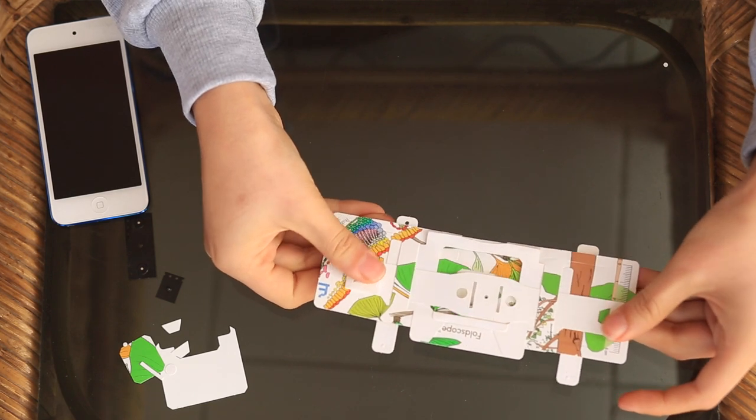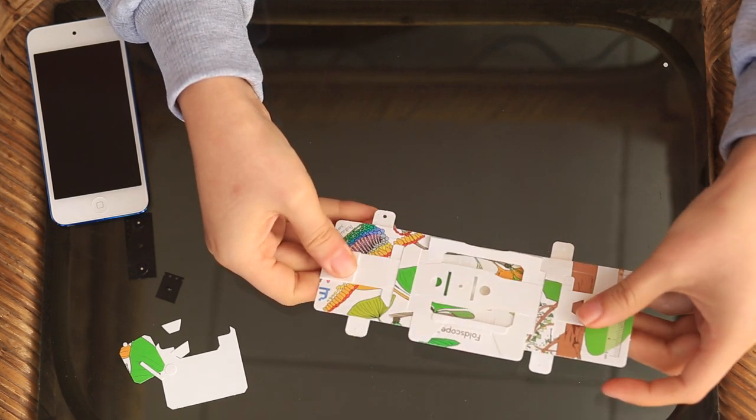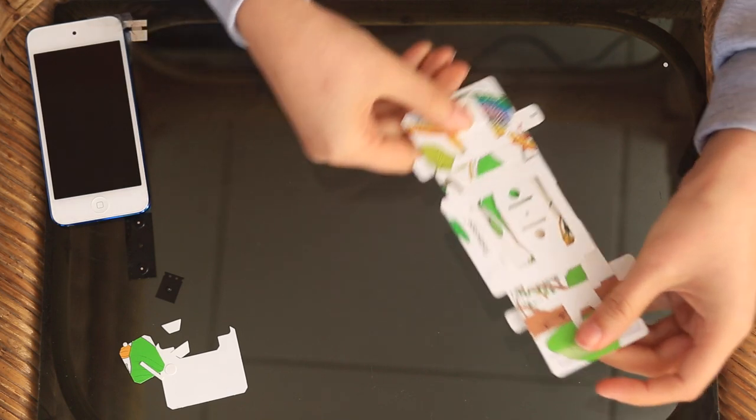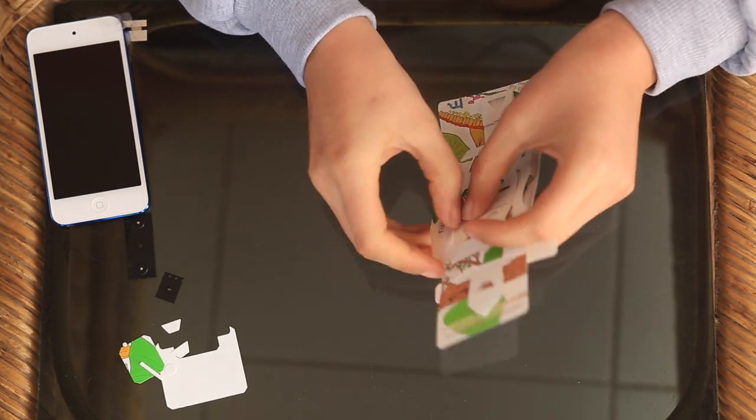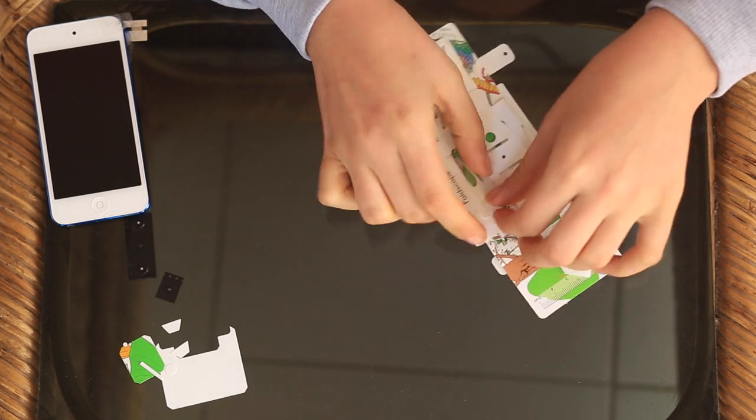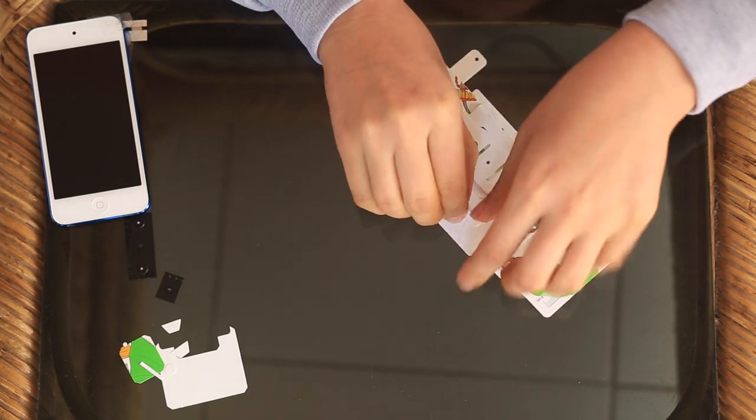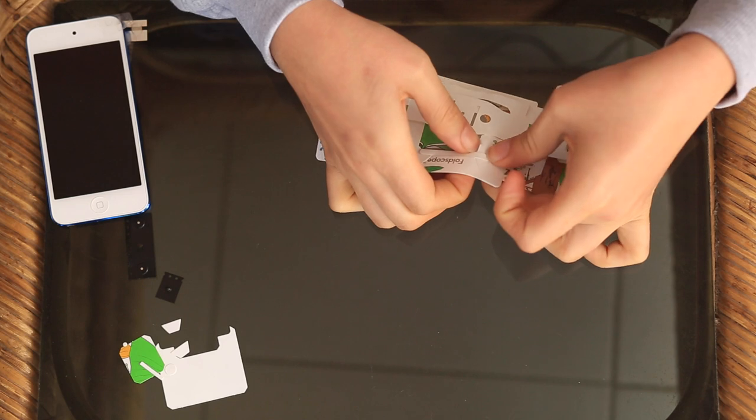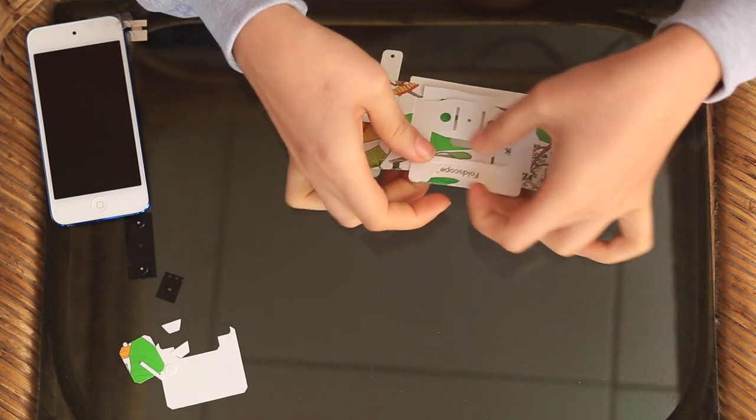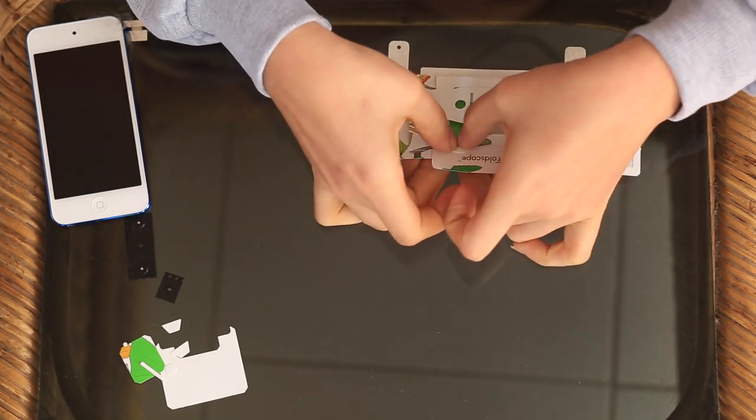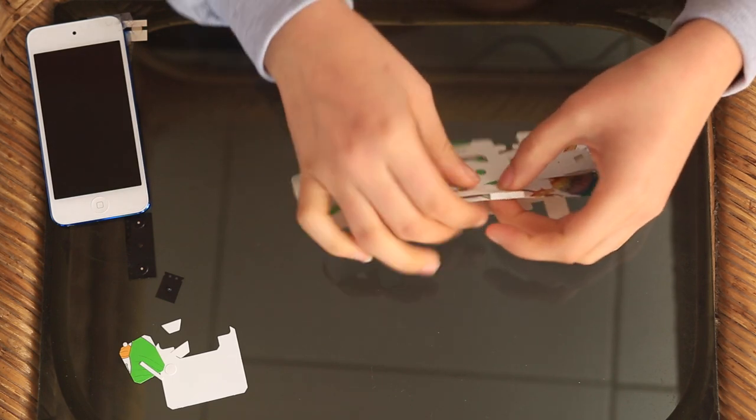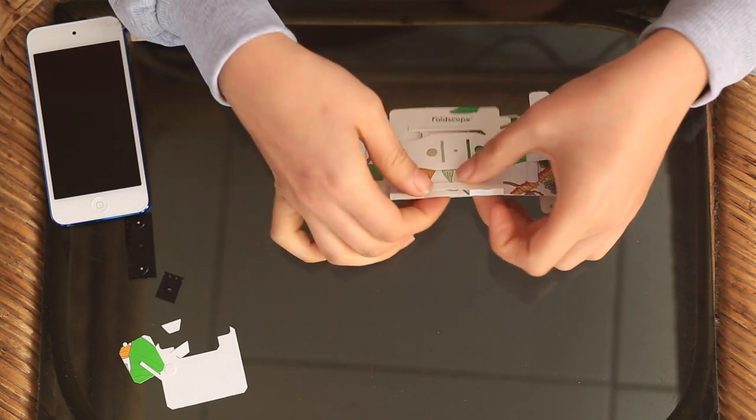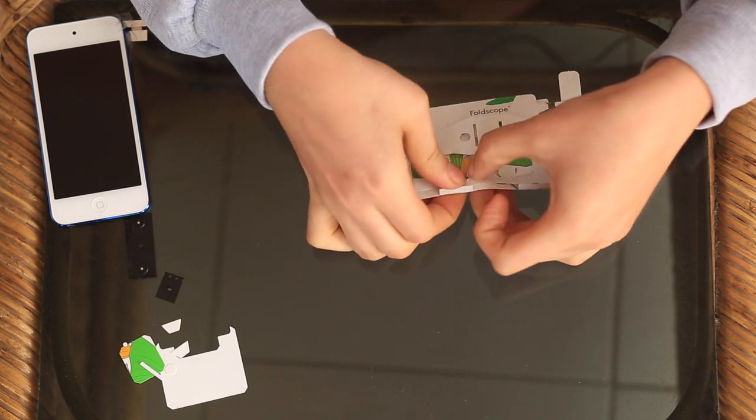So this is how you pan over your sample. Then you want to fold up these little flaps so that you're able to have your slide held well. So you fold them like that and like that. Then at the bottom fold them like that and like that.